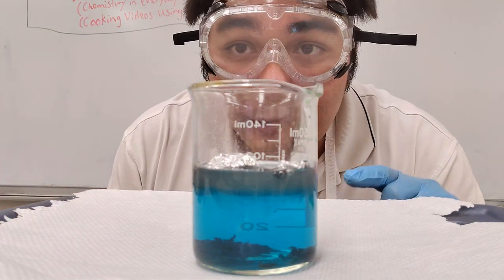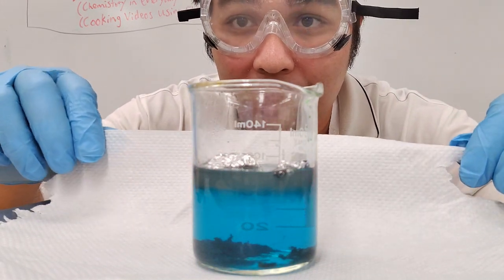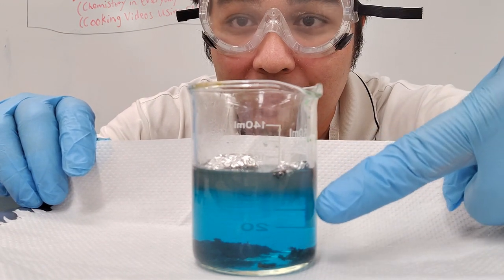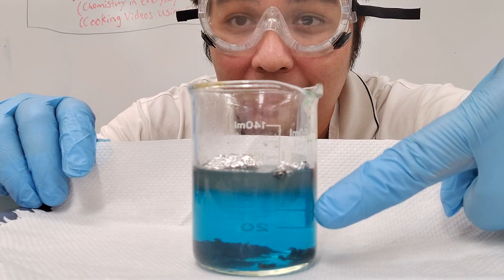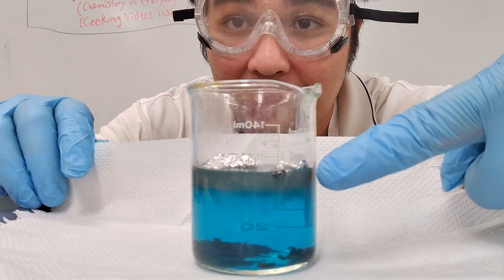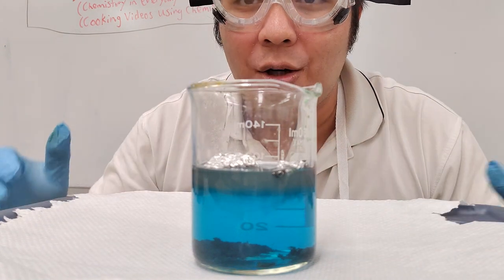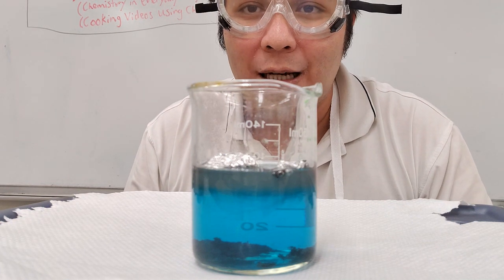One thing that might be a little bit harder to see, and I'll try to lift up the white sheet so that you can see more of a contrast. Do you notice that the coloring of the liquid over here is different from over here? That means this part of the copper chloride has not reacted with the aluminum, but this liquid over here has reacted. And so it's changed a little bit because now that's aluminum chloride. So I thought I'd feature that a little bit as the little end of the experiment.